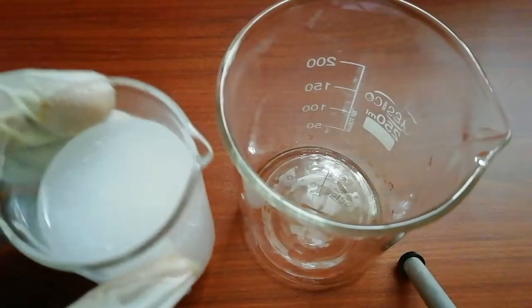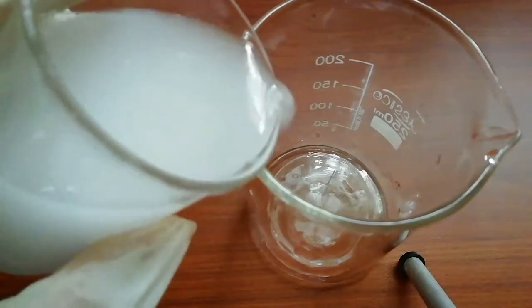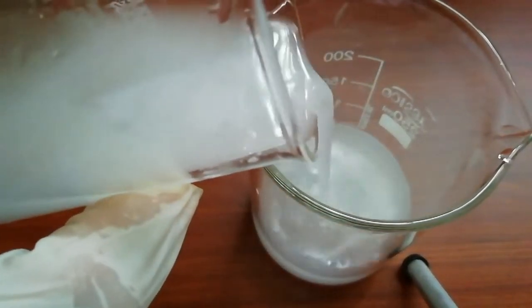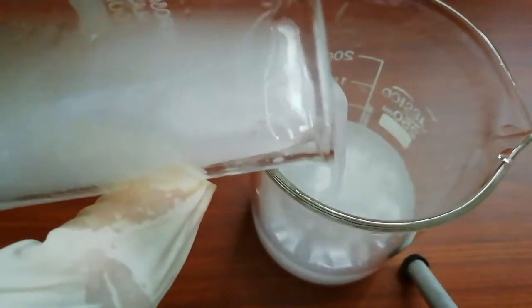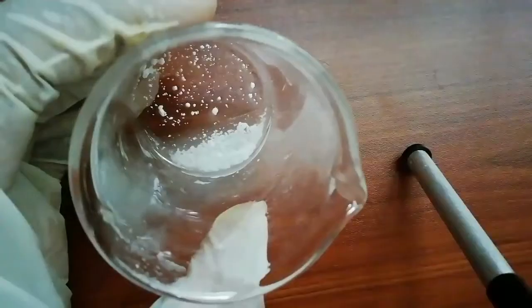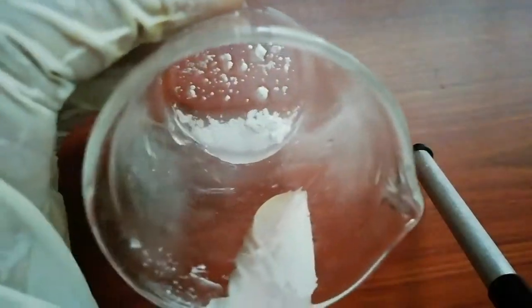Here is the solution. Now I remove excess water. You can see a white precipitate at the bottom of the beaker — this is silver chloride. We need to wash this precipitate several times.